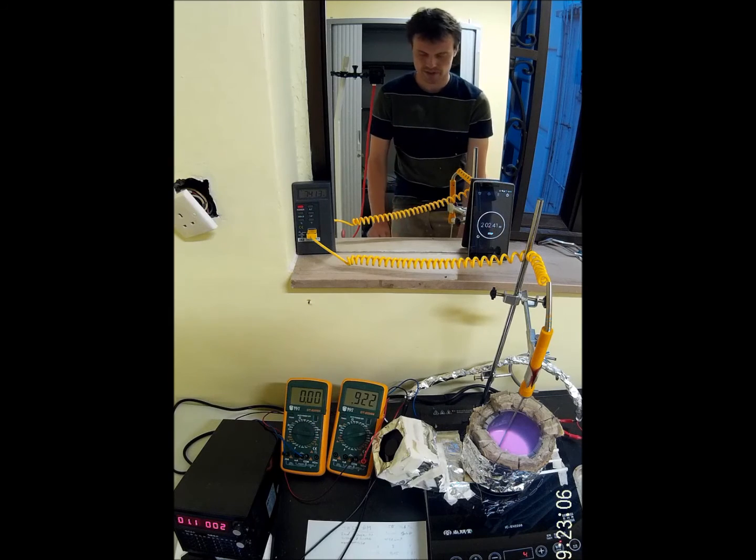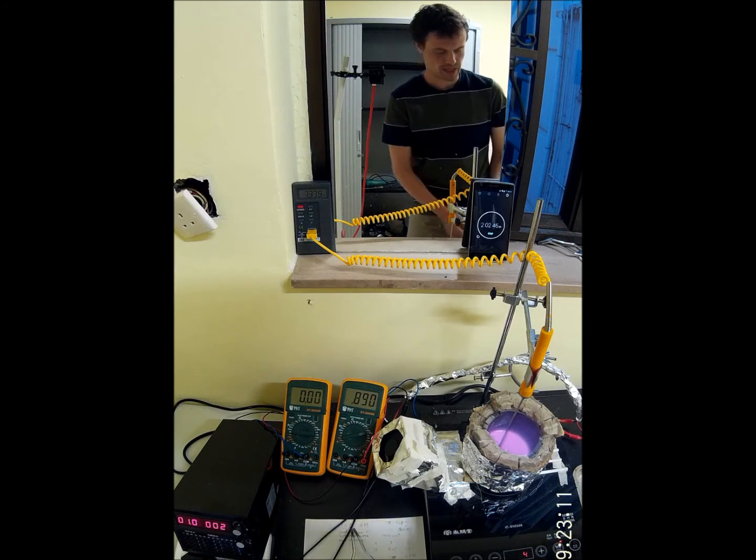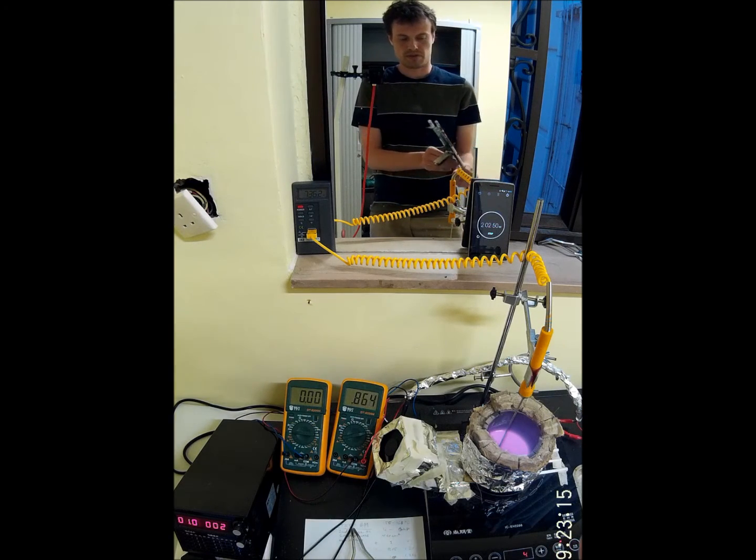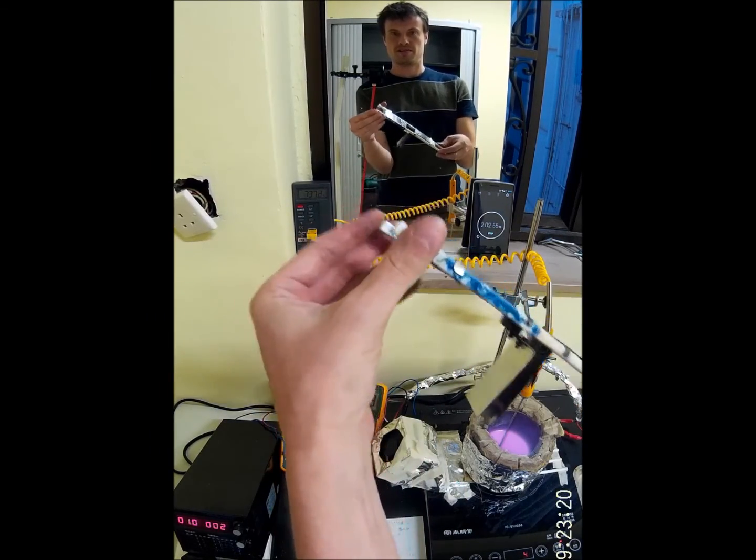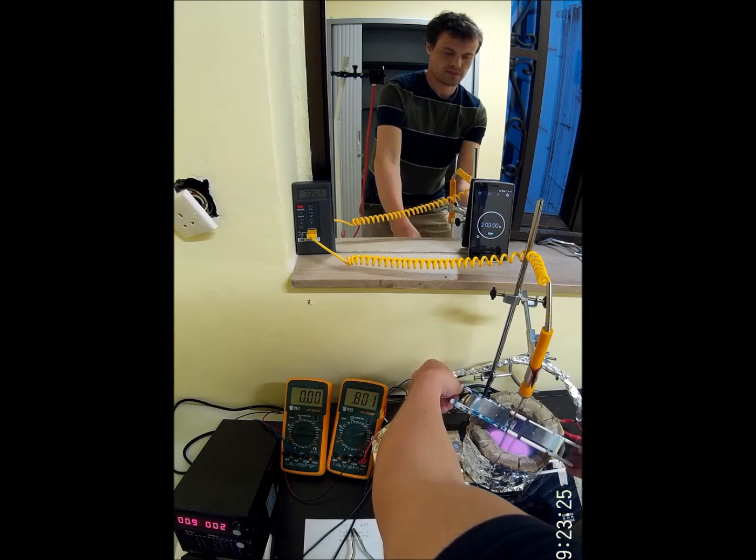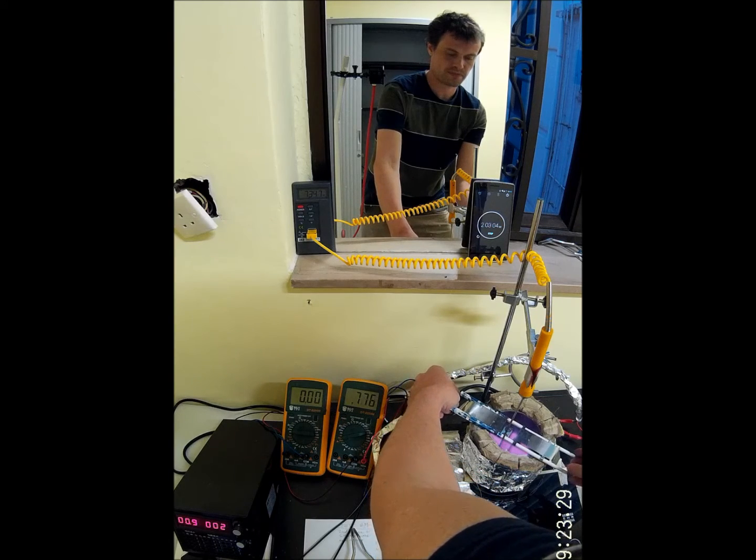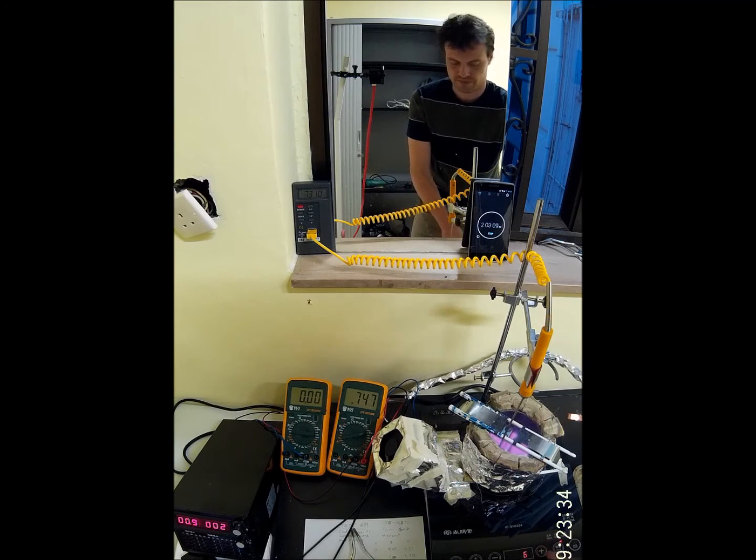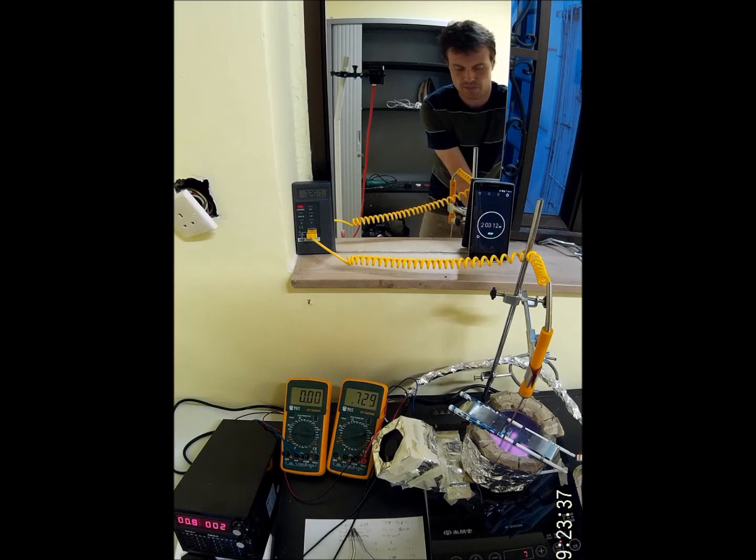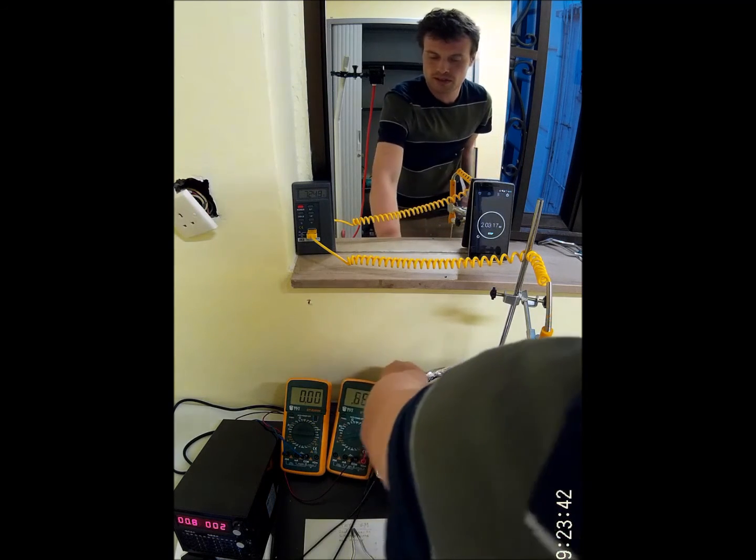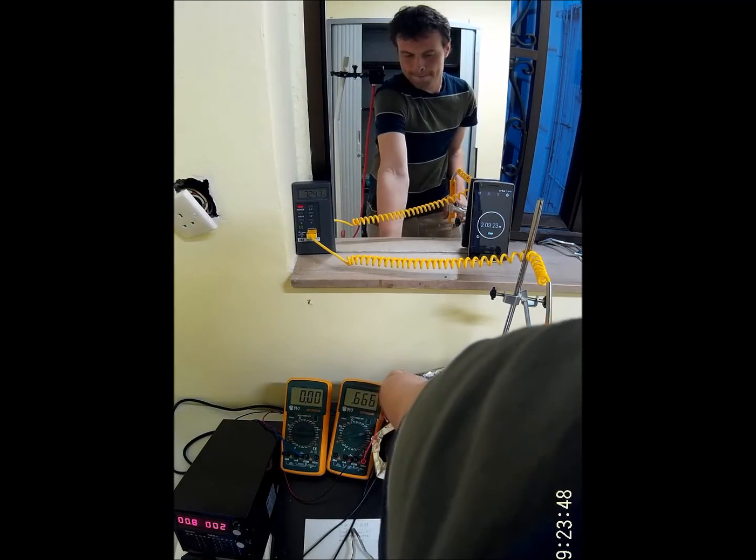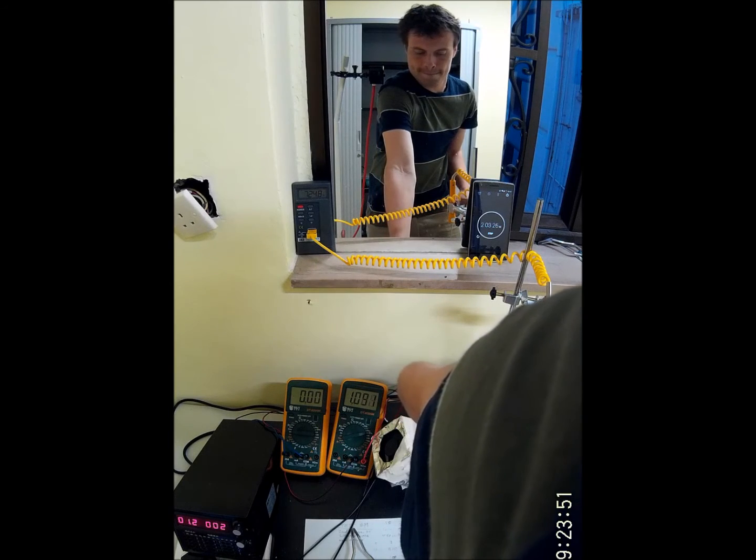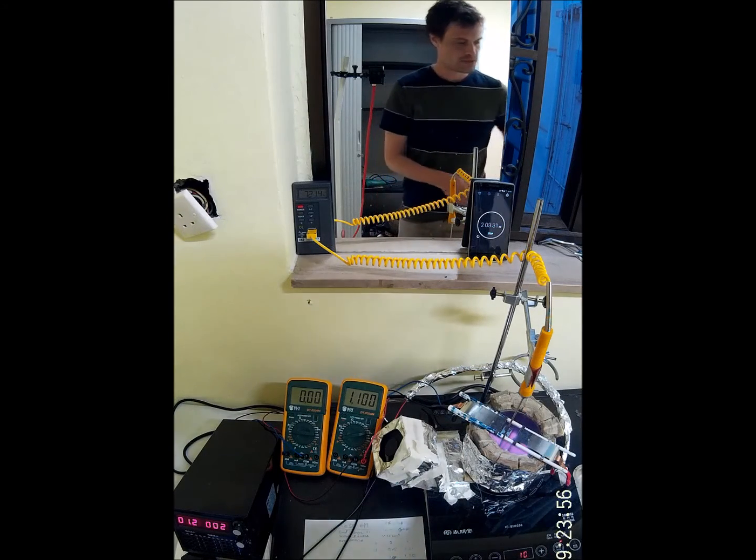I'm going to run another experiment immediately. I'll put a fresh set of electrodes into the mix. Put the lid back on.